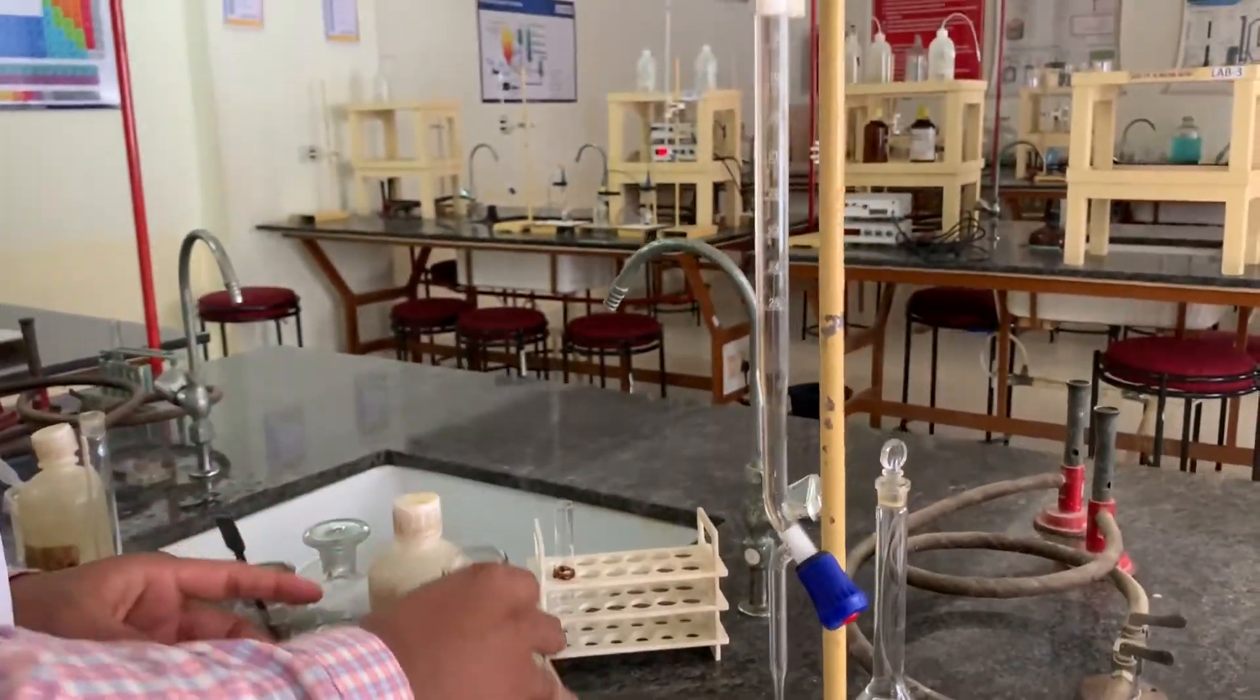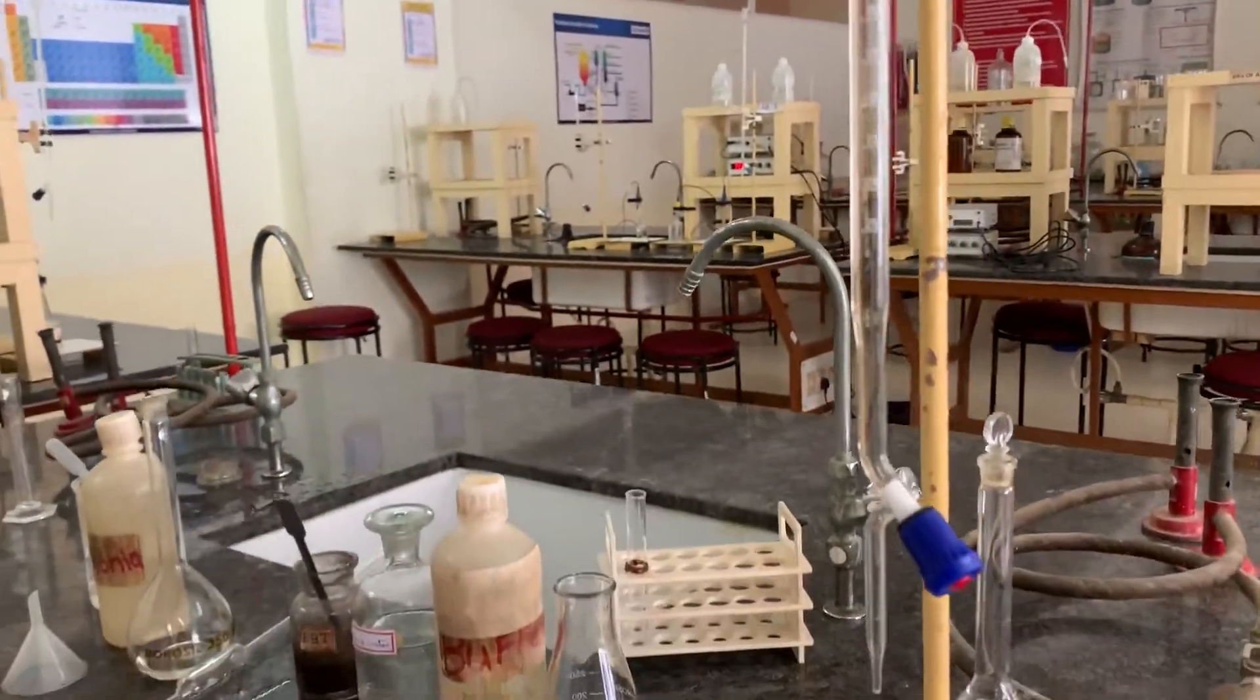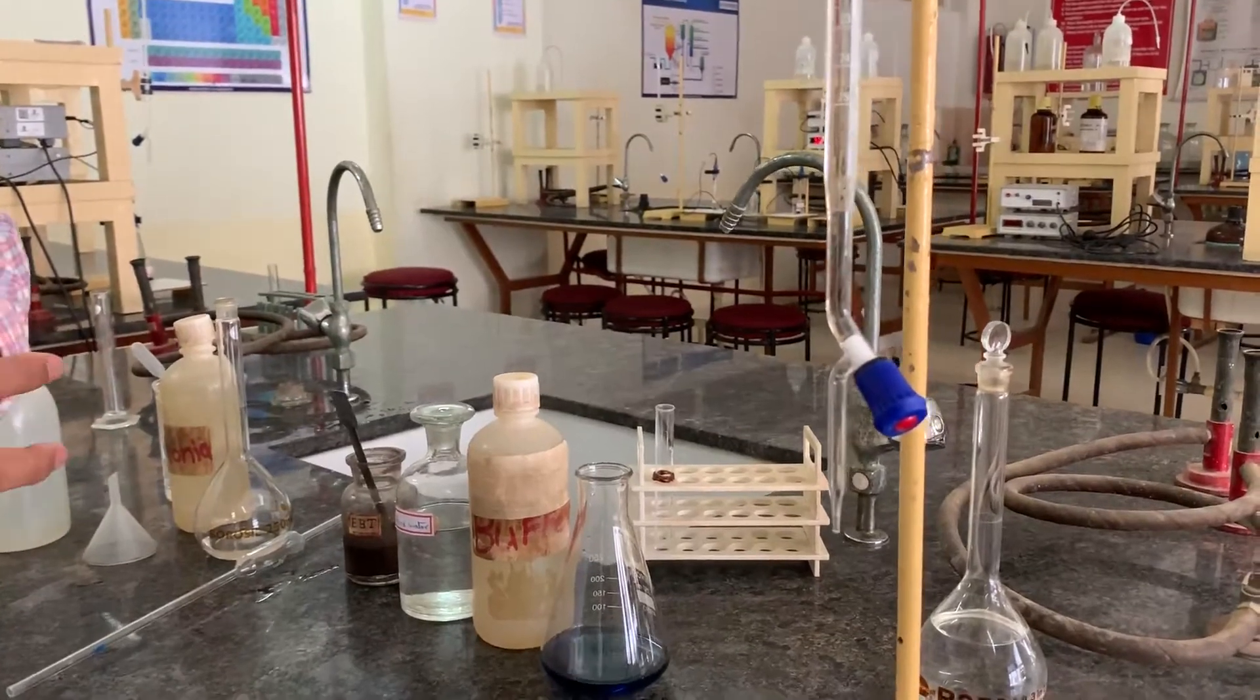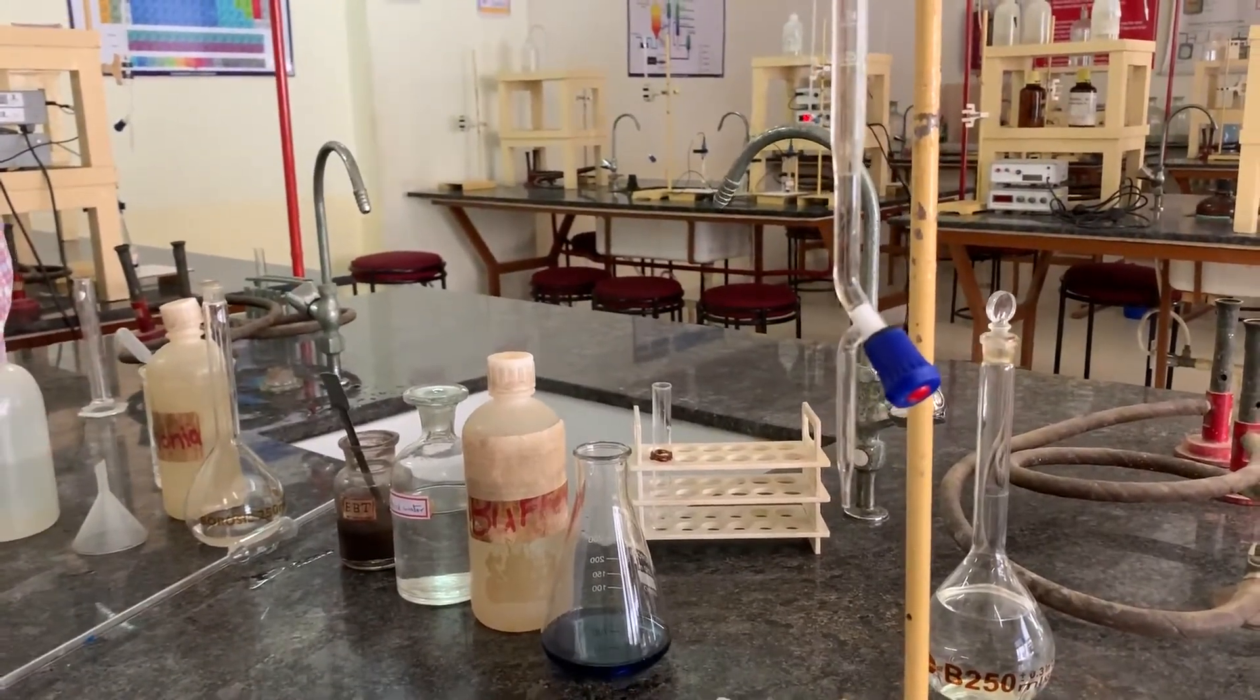Using this experiment, we will repeat the titration for two more trials. A total of three trials we are going to record and then we are going to calculate the total hardness of water using the calculation.